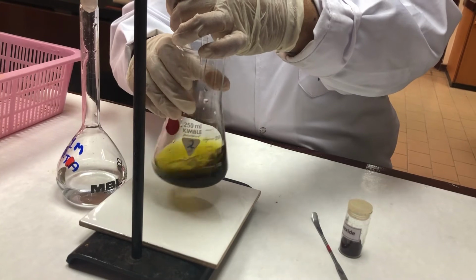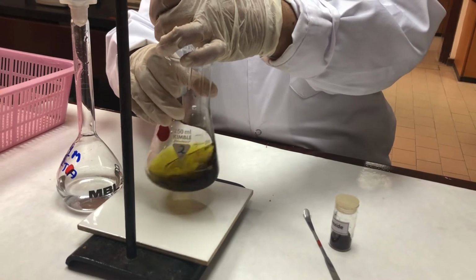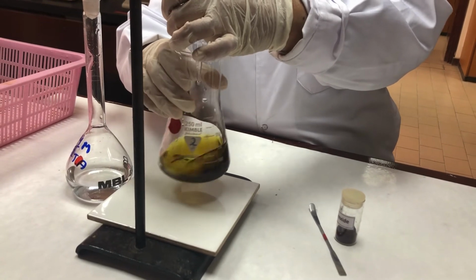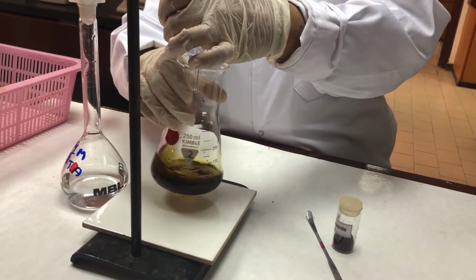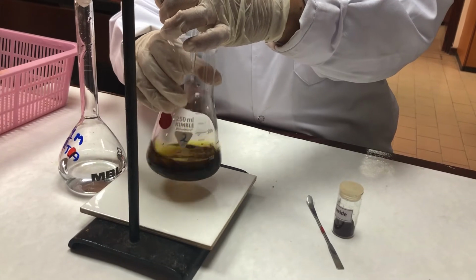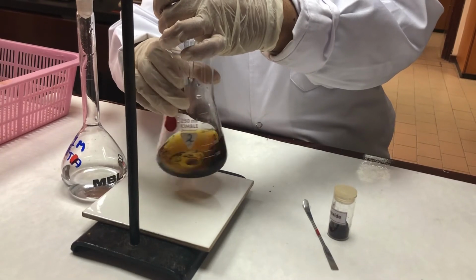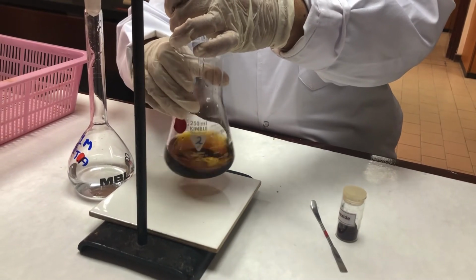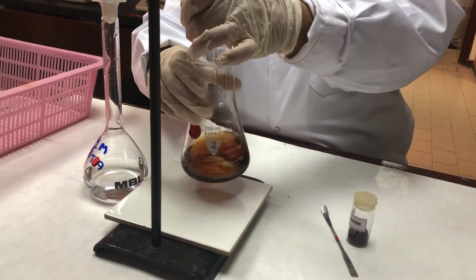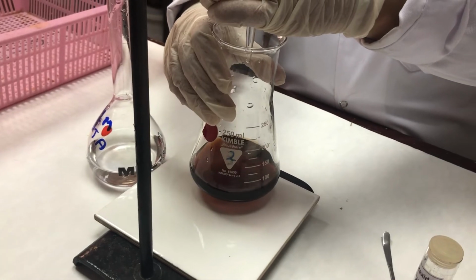The color was yellow in the beginning, yellow and greenish when I had added the indicator. Before, the color was green for nickel sulfate. As soon as I added the indicator, the color turned into greenish yellow. And now I'm adding EDTA. This should be a reddish purple wine color. Going in drops. Now, still maybe another 2 or 3 drops will give me that color.